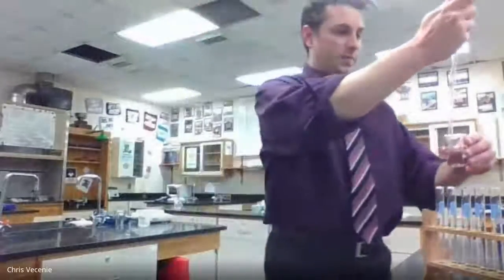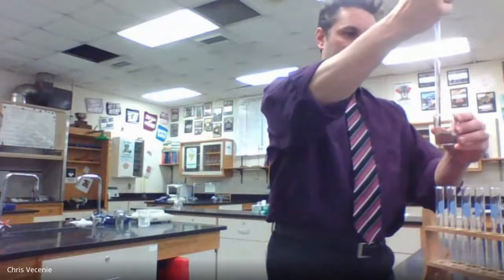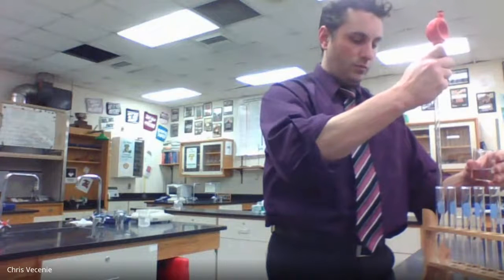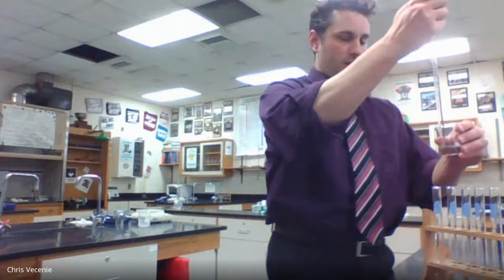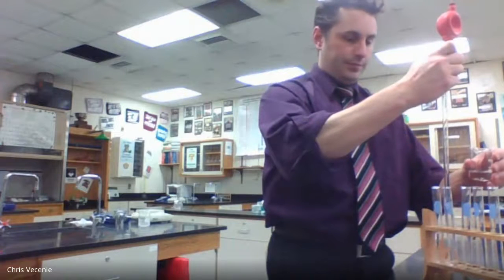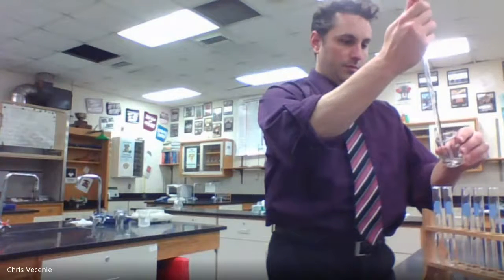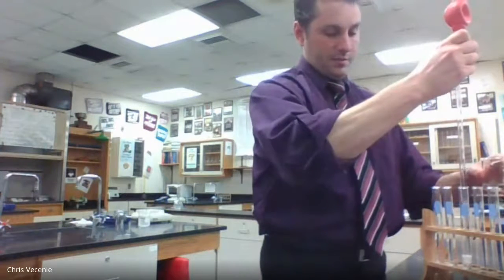Hopefully you can see it. You always overshoot your line, then work it back down. There's my 8. I'll do the same thing: overshoot, and then back. There's my 7. There's my 6.